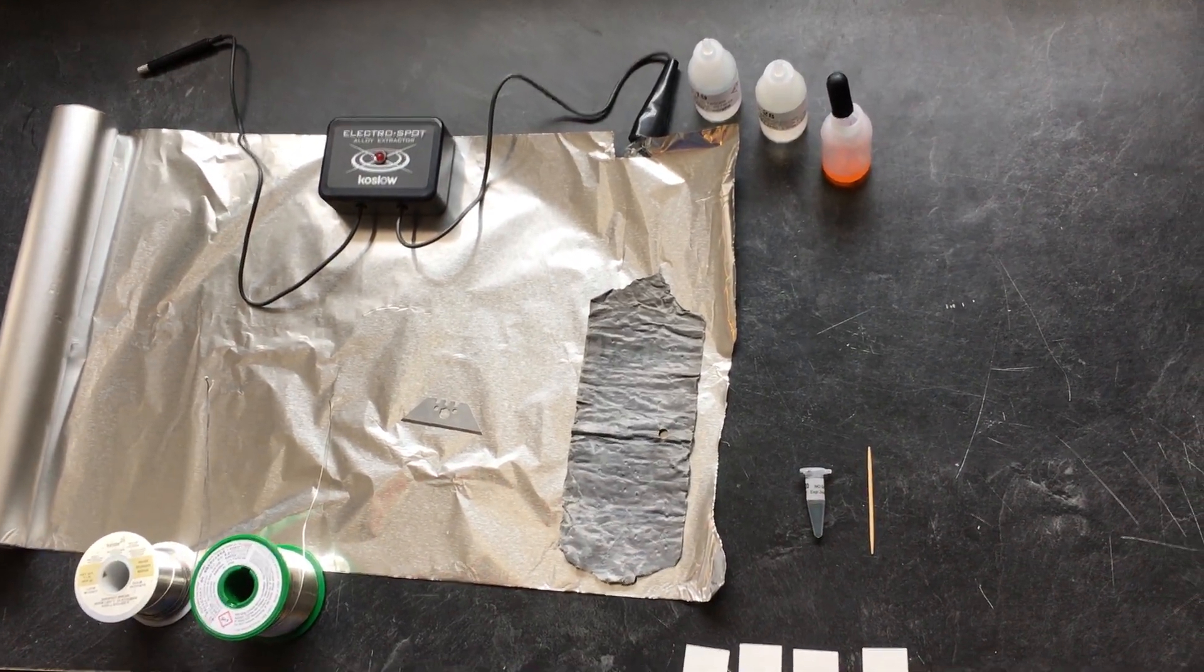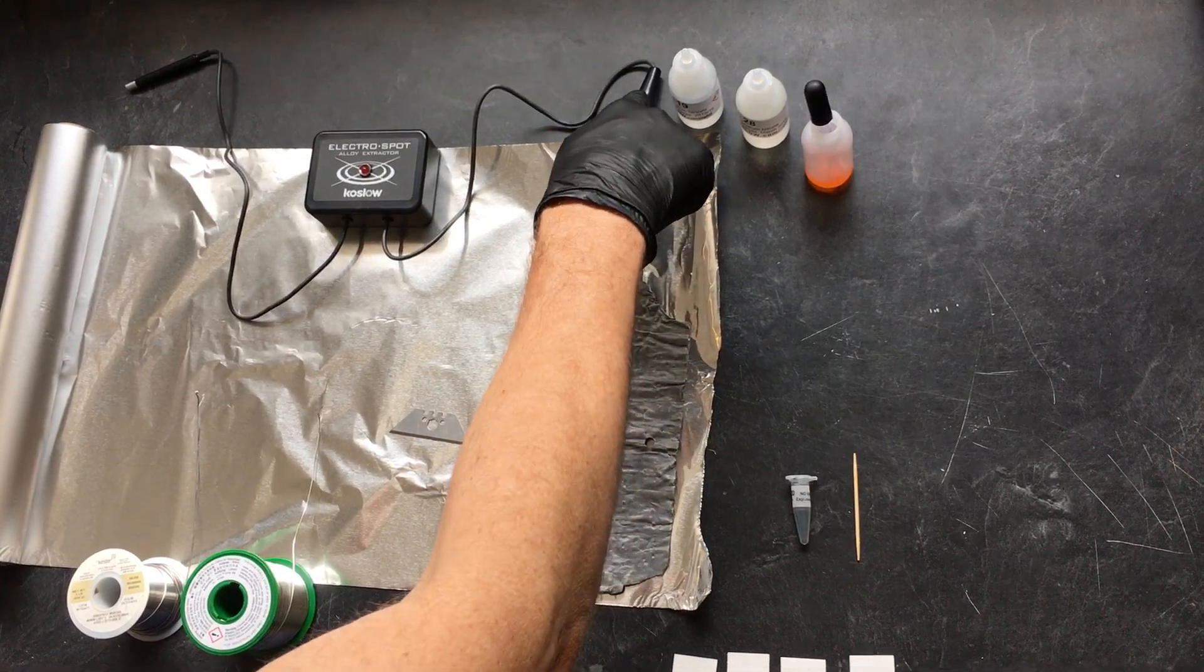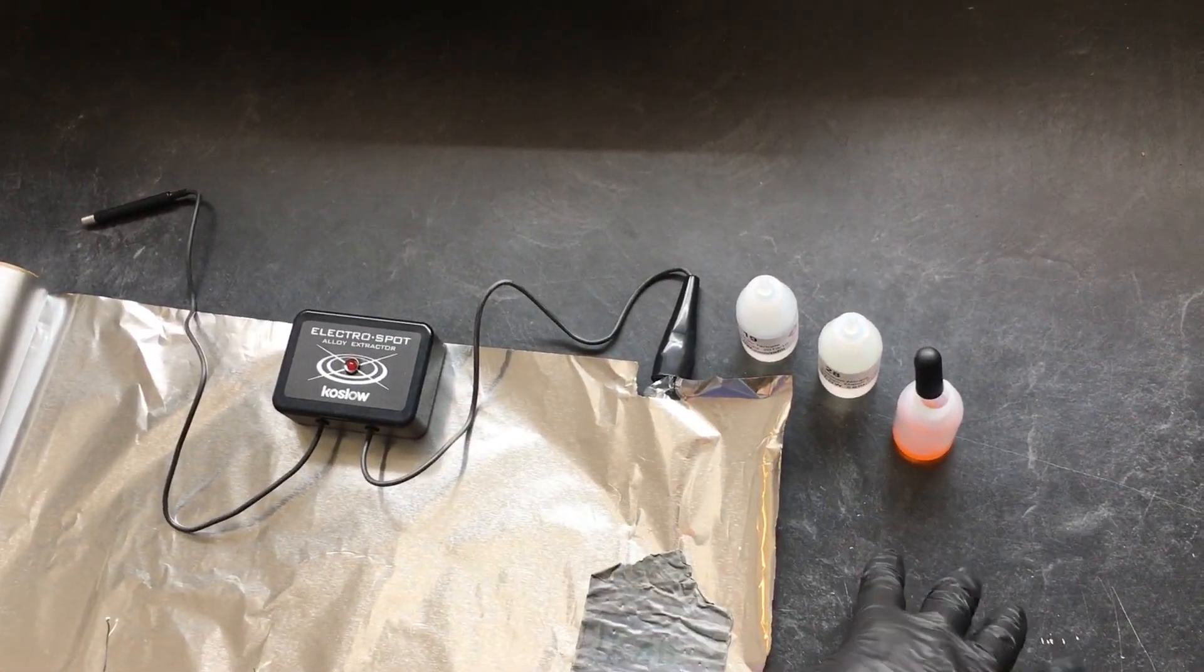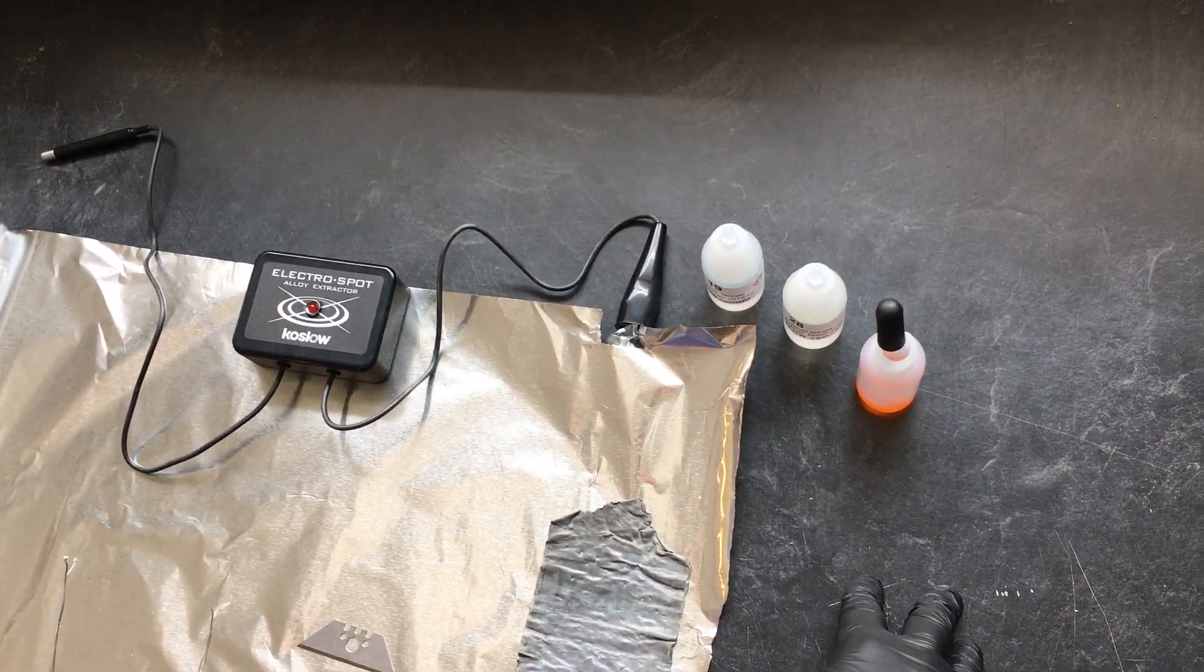So the first step is, as you can see here, I clipped on with an alligator clip onto a piece of aluminum foil. I'm going to be doing four tests at one time.